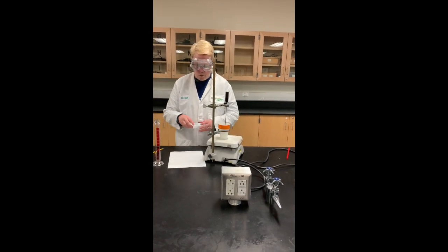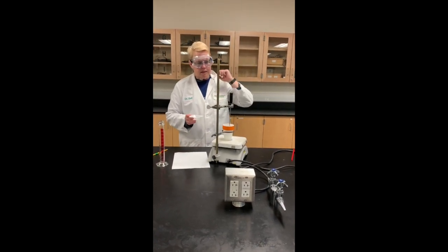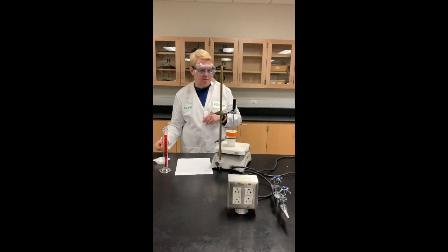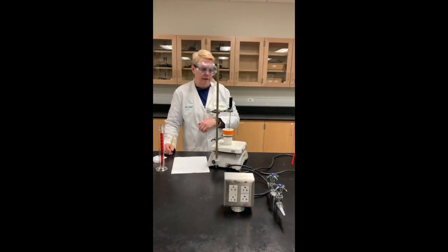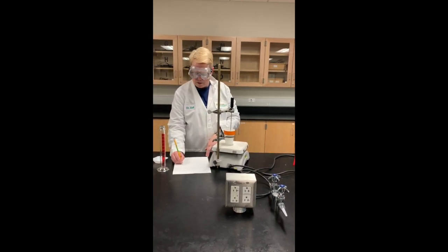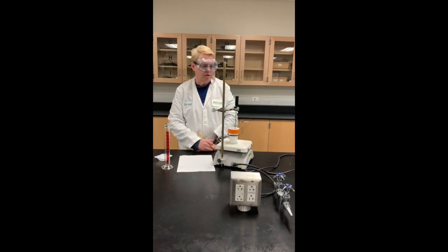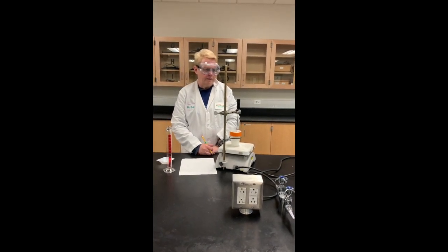We've weighed out 4.9971 grams of ammonium nitrate and I'm going to add it to the cup. We're supposed to be taking temperature readings every 30 seconds. We add it and immediately notice the temperature is going down — we have a temperature of 19.4 right now, and it's kind of stabilized at 19.0. It's now at 18.8.